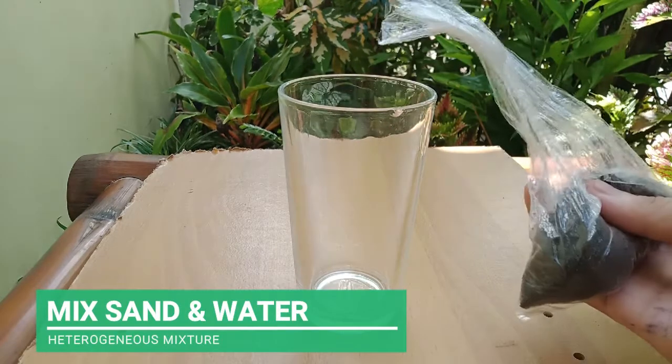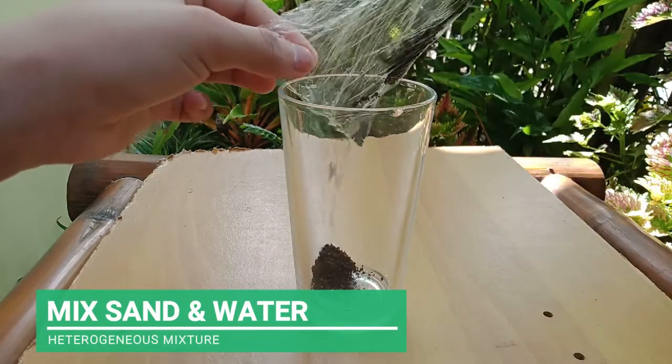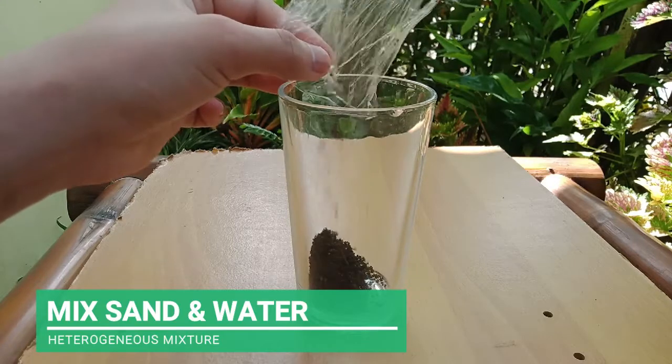To create the mixture, first we need to mix sand and water.